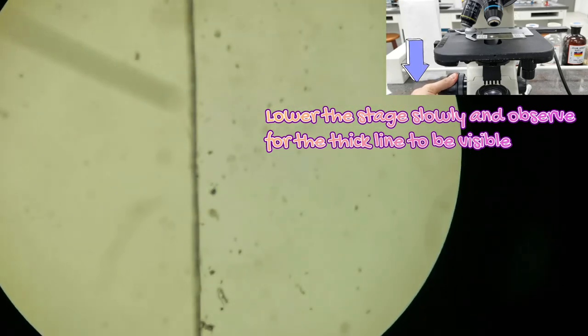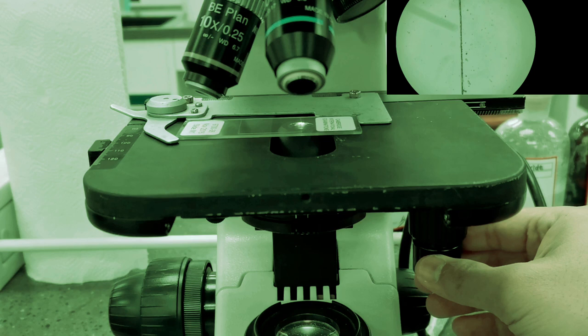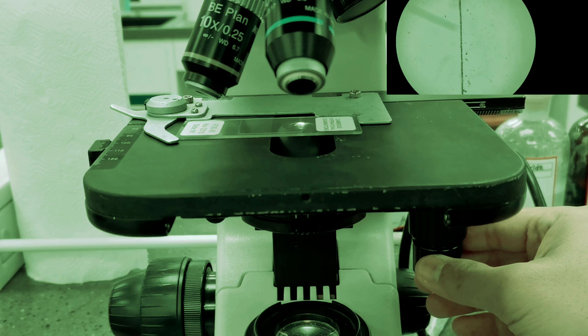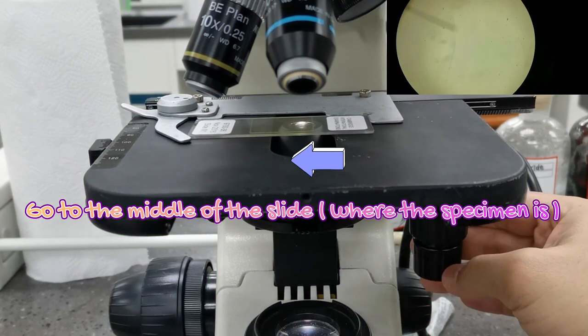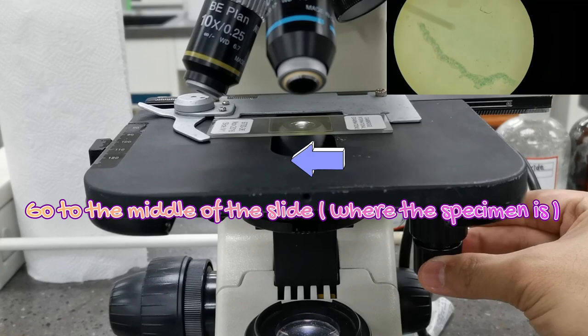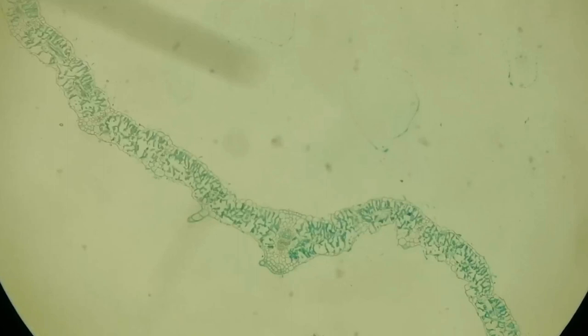As I lower the stage, the view of the edge of the cover slip becomes clearer. Once you've caught the edge of the cover slip — because it is coarse, thick, and hard to miss — you can use the knob to move to the middle of your slide and start looking for the actual specimen. Use the knob to go to the middle of your slide and you shall find the specimen.